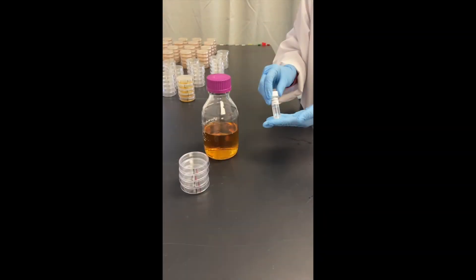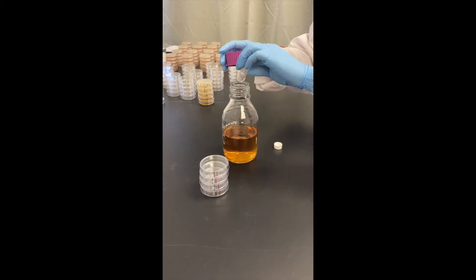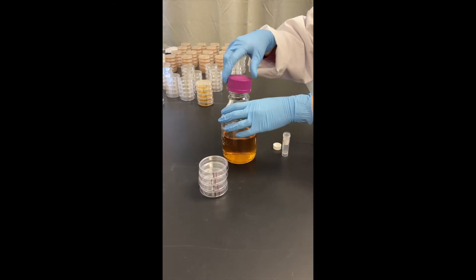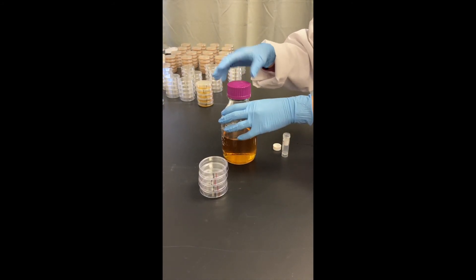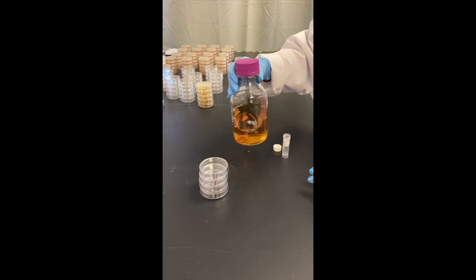Now that our LB agar has cooled down, we can add the antibiotic ampicillin. After we add the ampicillin, we give our bottle a swirl to make sure the ampicillin is mixed in evenly with our LB agar liquid.